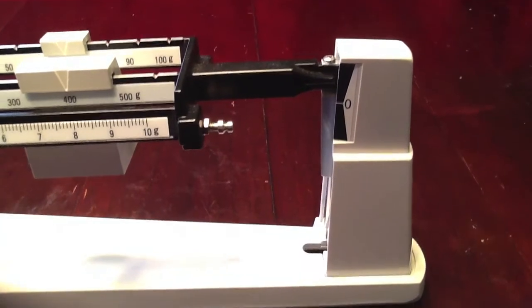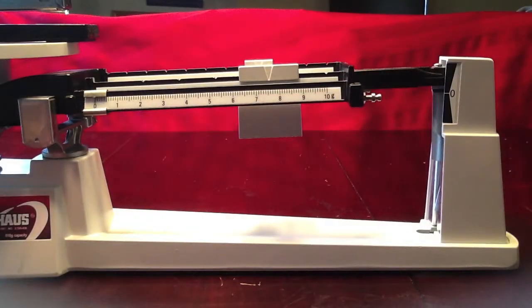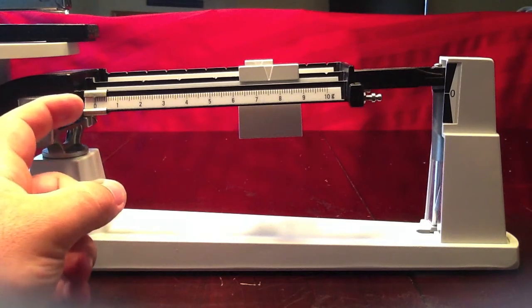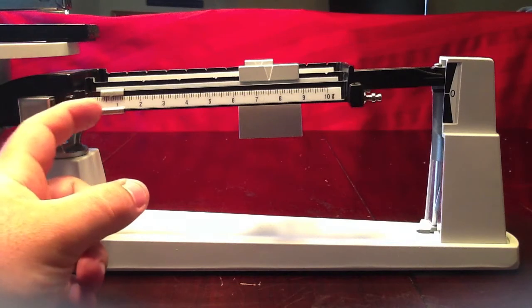Now we are just above the zero. Now it's time to move our third and final rider, the one gram. It's best when moving the one gram rider to just slightly tap with a finger.